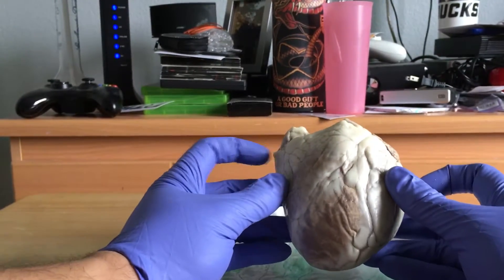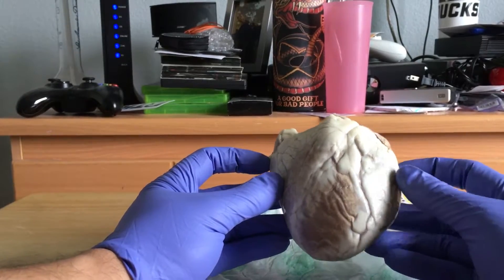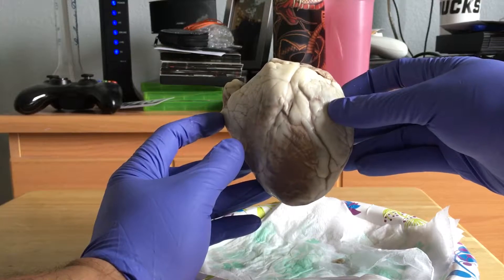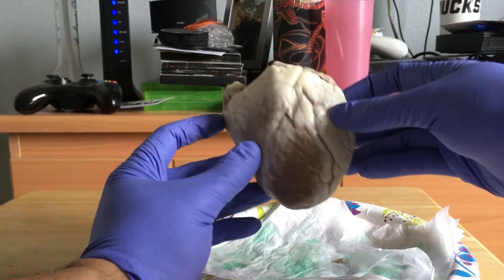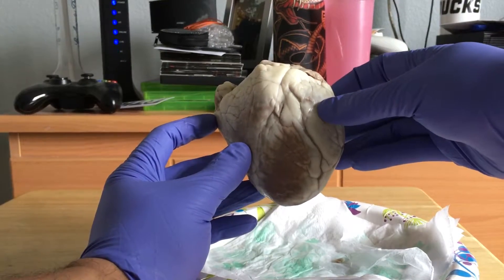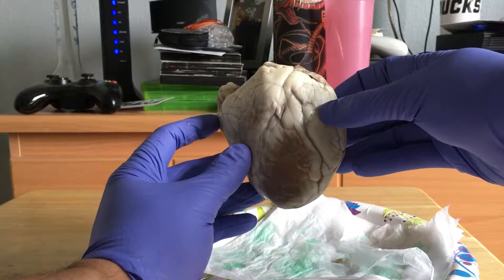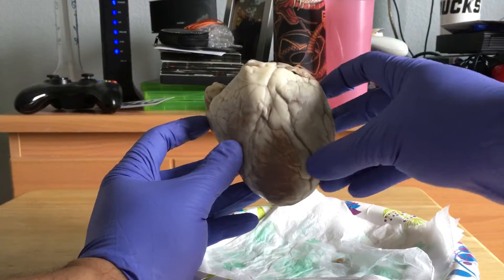Over here you have the right auricle, and over here you have the left auricle. The right auricle collects deoxygenated blood from the bloodstream and sends it to the right ventricle. The left auricle collects oxygenated blood from the lungs and sends it to the left ventricle, so it can go ahead and send it out to the body.